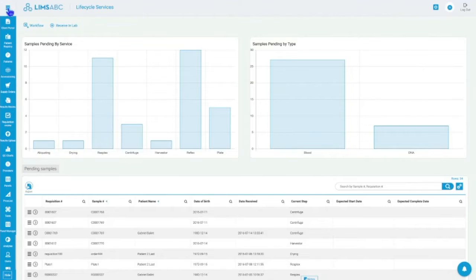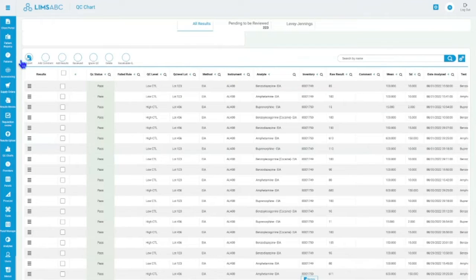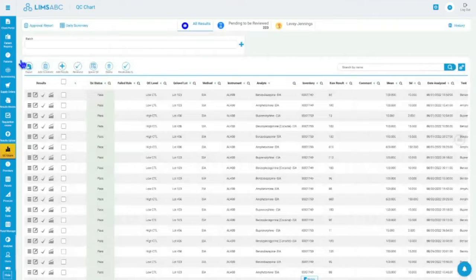So we have two applications. One is for the setup and one is for the actual QC results. So every time we can get QC results in multiple ways. We can get QC results from the file, right? So if you're thinking about Quant Studio, we can get results from there. We can get results directly from the instrument, right? If it's a chemistry or if it's AU, for example, we get the results straight from the instrument. The file, the LCMS for toxicology, will get the QCs from the file as well.